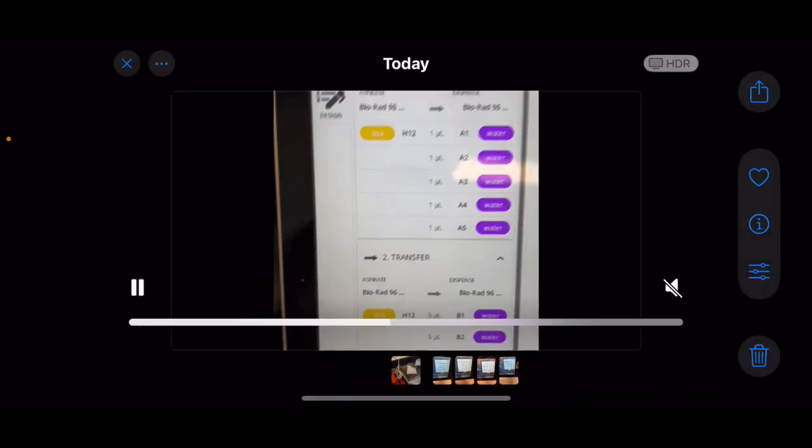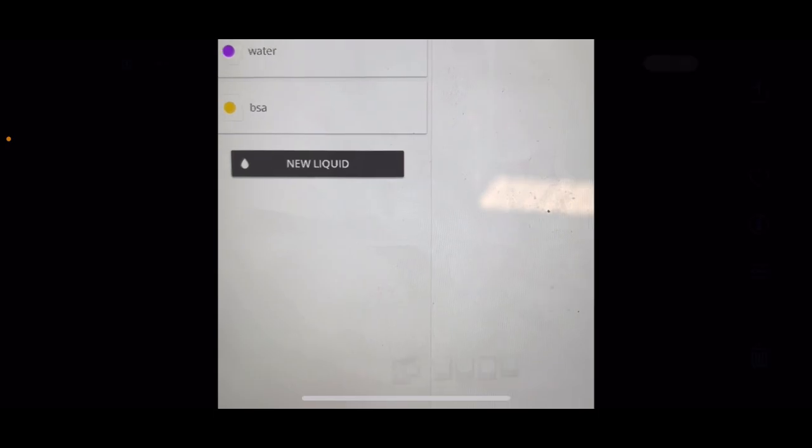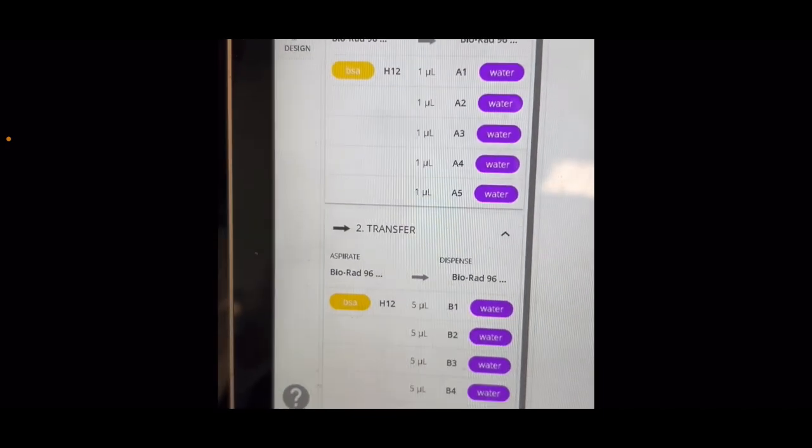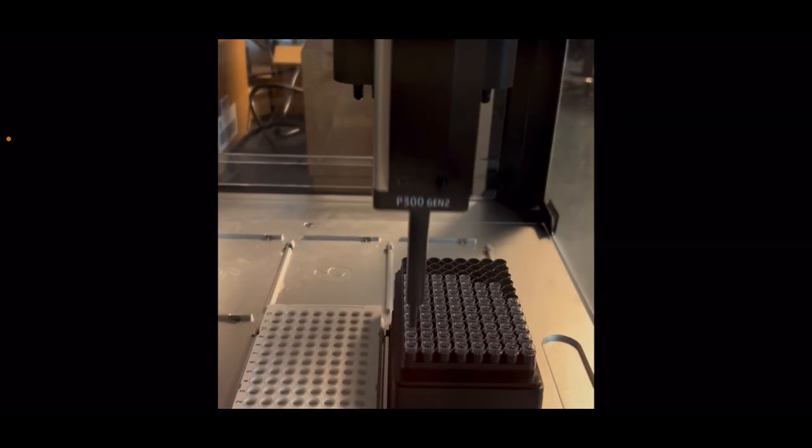This is my procedure. As you can see, it's going to be pipetting from H12, which is where I have a large quantity of the BSA stock that I made. It's going to take it from there and add 1 microliter from A1 to A5. And then it's going to do the same thing for B1 to B6 with 5 microliters. This is how my deck will be set up, and those are the reagents.